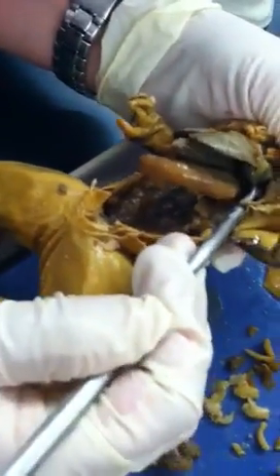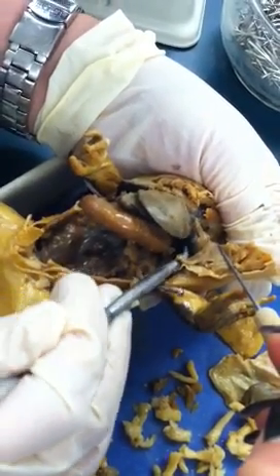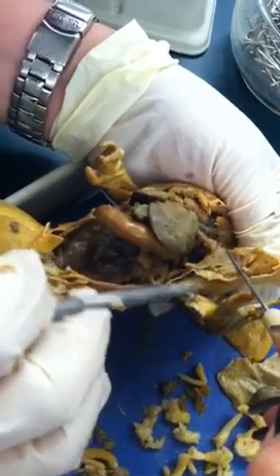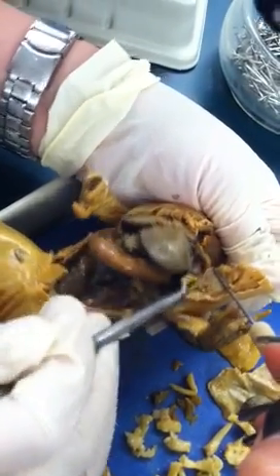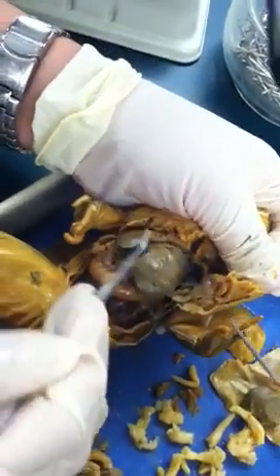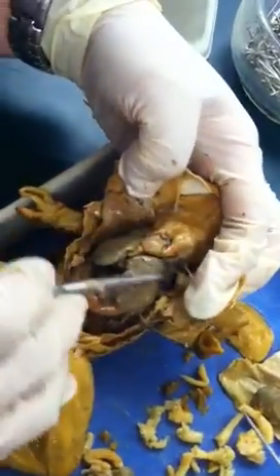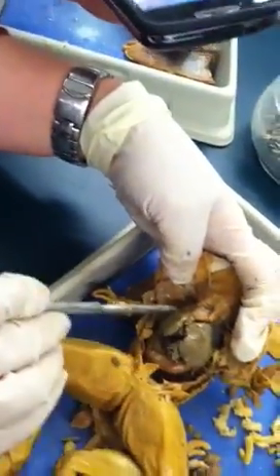Here is the lung — right there. If I flip it, you can see it better. Pay attention to where it's pinned: if something is pinned right by the arms, that will be the lung. If it's right on top of everything, that's the liver. Lungs are one on each side, right by the heart.